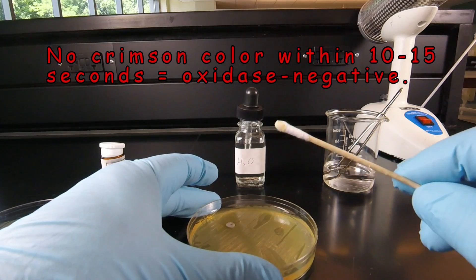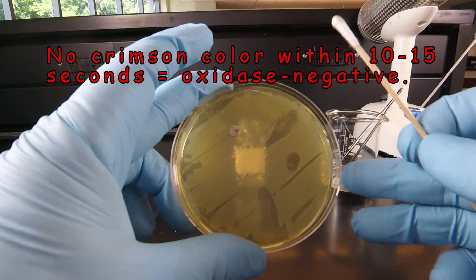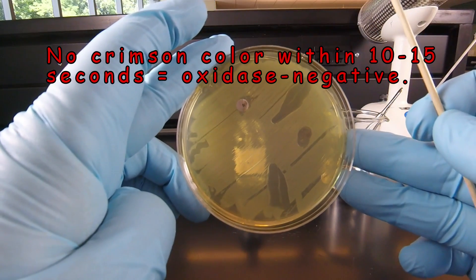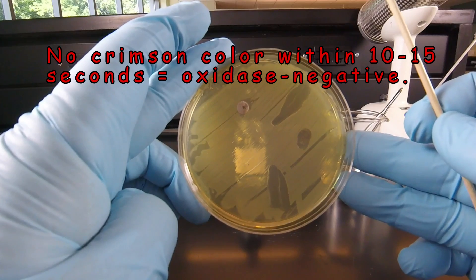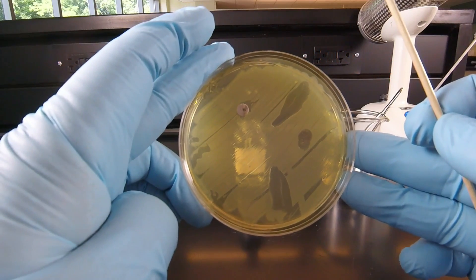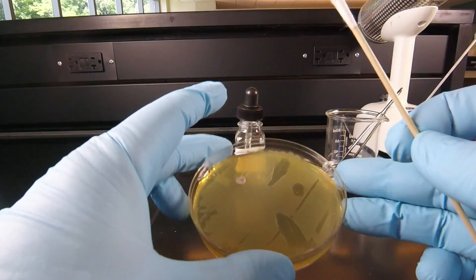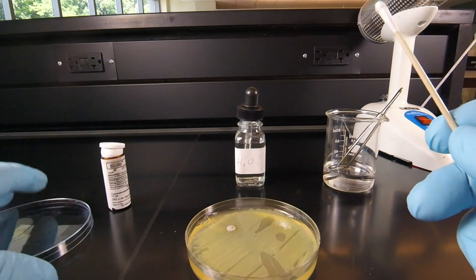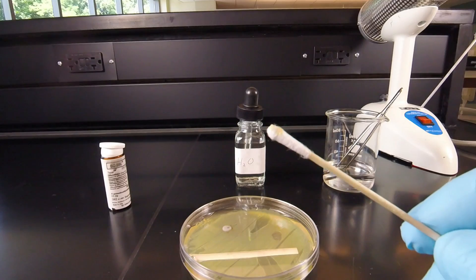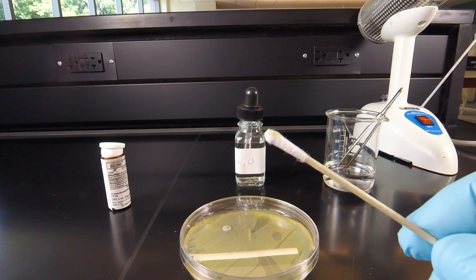You'll notice that there's no color change on the swab and no color change on the disc. That is an oxidase negative test. If it were oxidase positive, it would turn a crimson color within about 15 seconds. When finished, the used swabs go in the biohazard container.